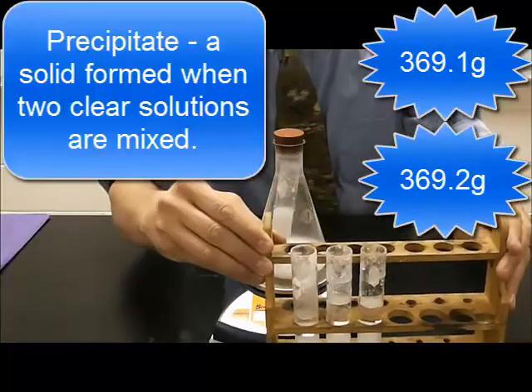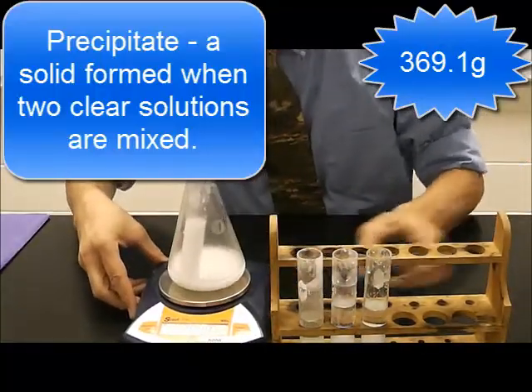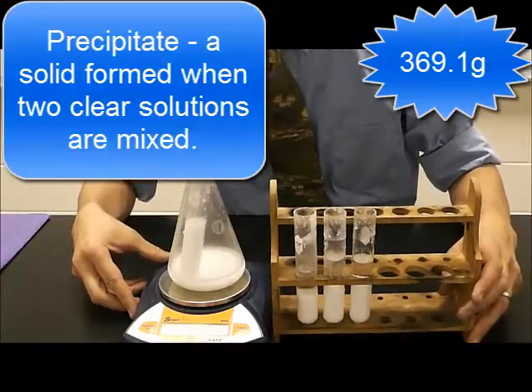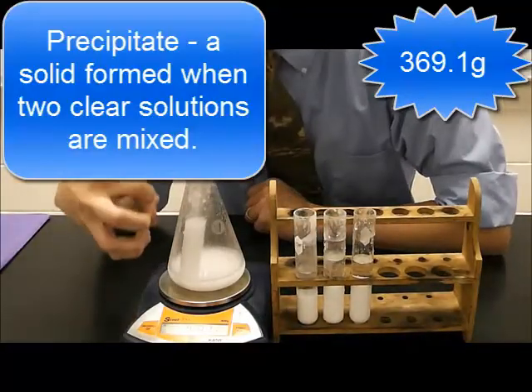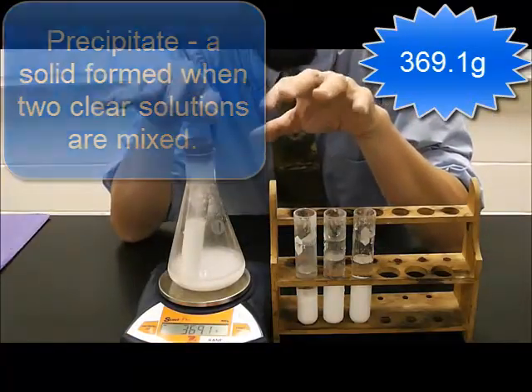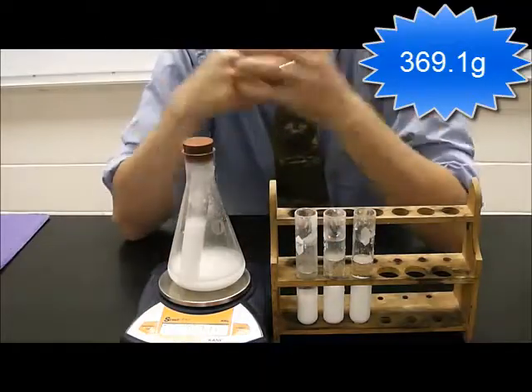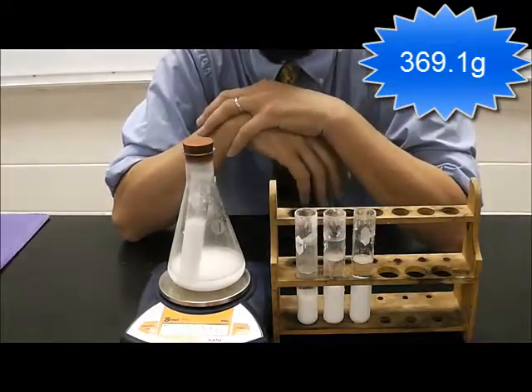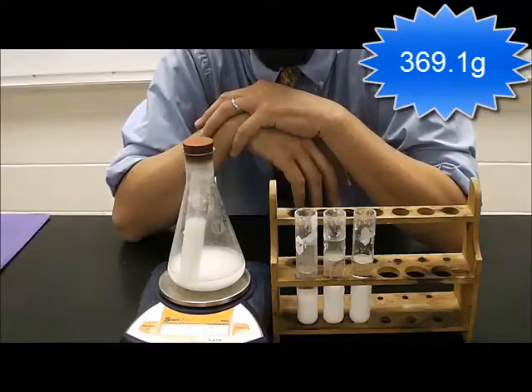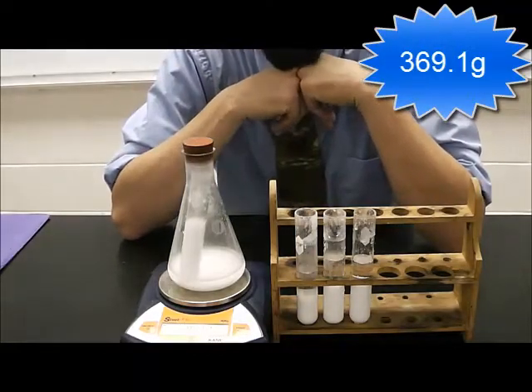If you want to see some that we've done before, they're right here. And this actually should give you a good idea of where the word precipitate comes from. We've got this white solid that's created in the middle of the solution. And what happens is it slowly precipitates down to the bottom. So it's kind of like precipitation that happens outside, except for we call it a precipitate.